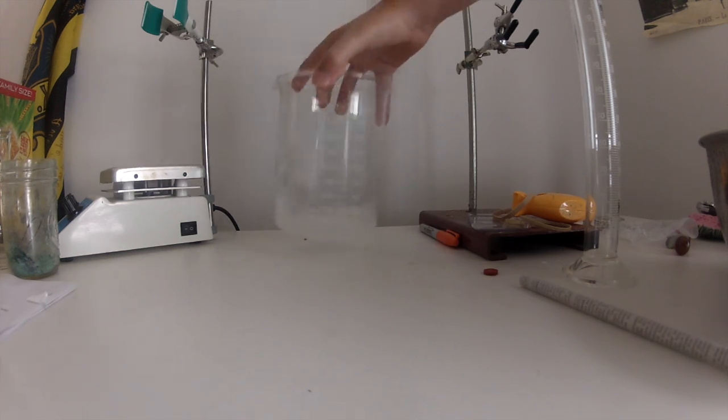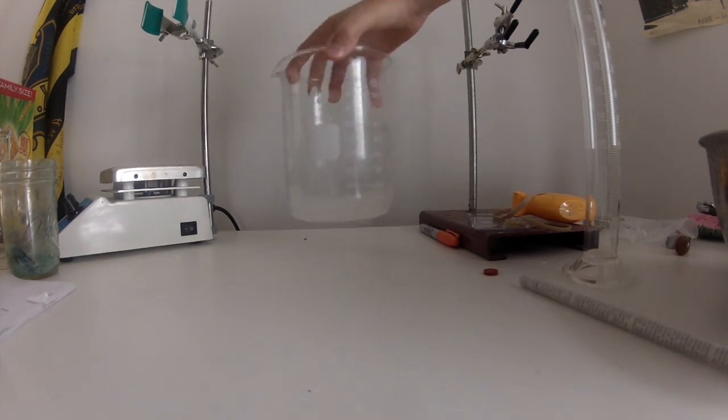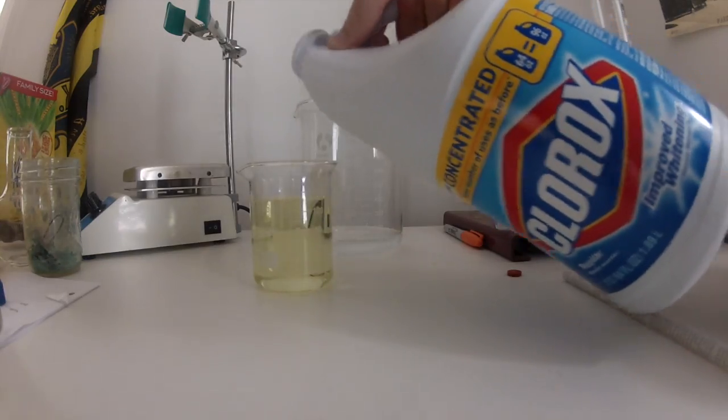Then add 125 milliliters of water. Dissolve all the sodium bromide.